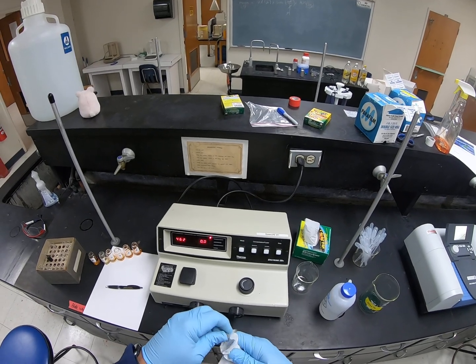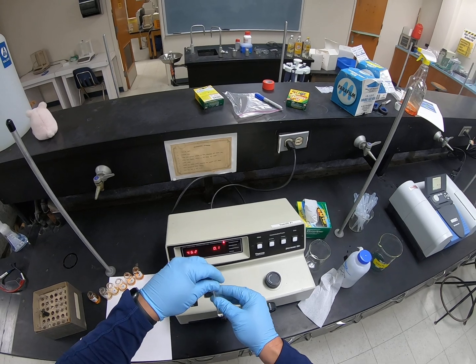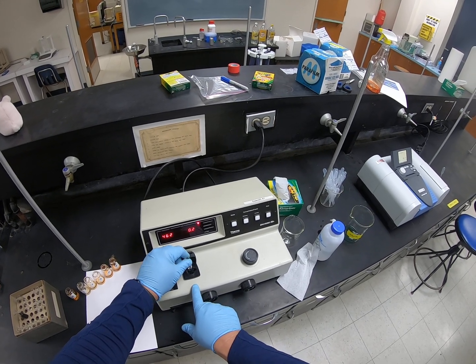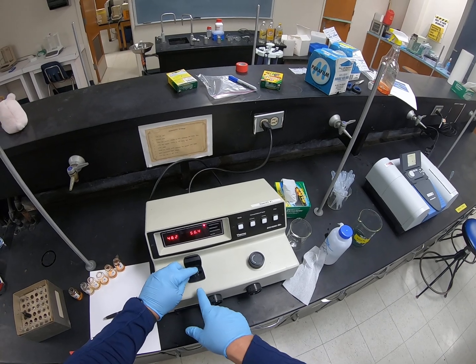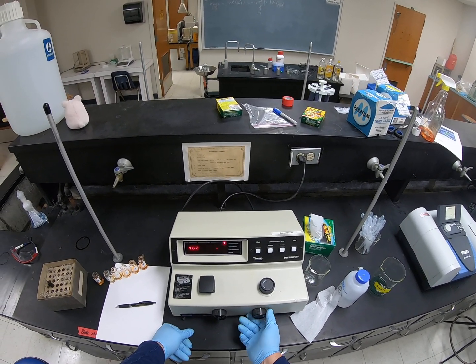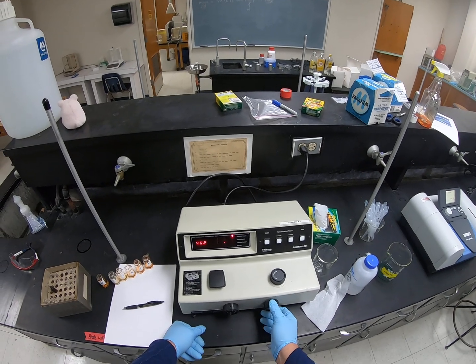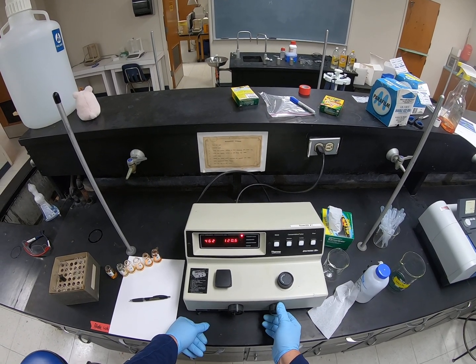Now to calibrate it, what I do is I put in a blank that's just got water in it. There's usually a little mark on the front of these. You can see there's a little dimple in the plastic here. To make sure that you put the cuvette in the same way every time, I'm lining that B up on the front. So now with water in it, I'm going to take the knob on the right-hand side that says 100% T on the front of it, and I want to dial it in till it reads the value of 100.